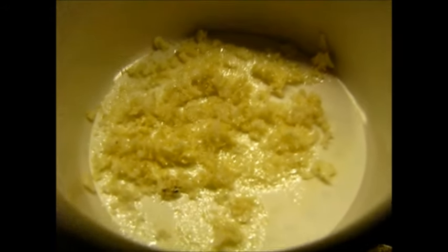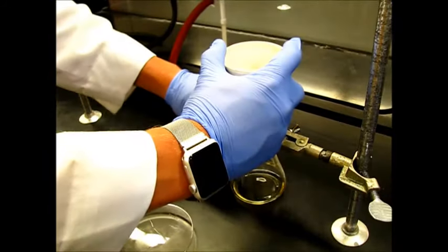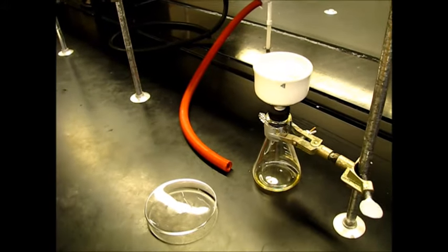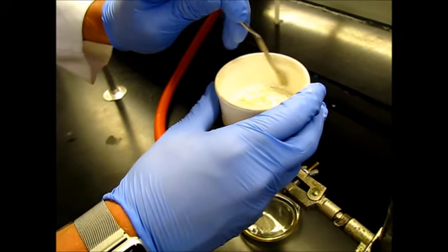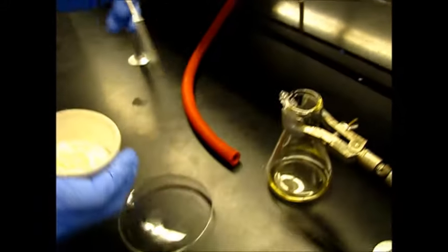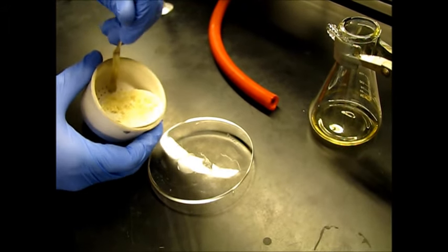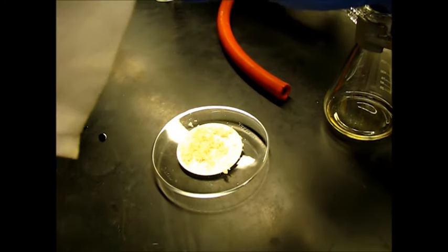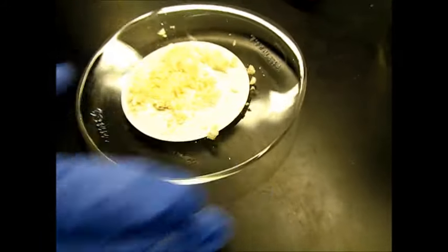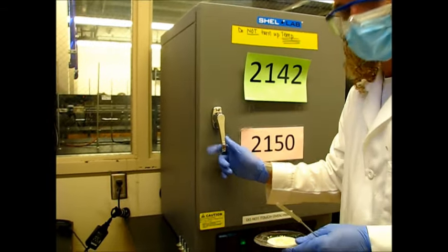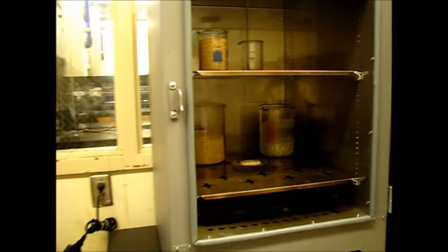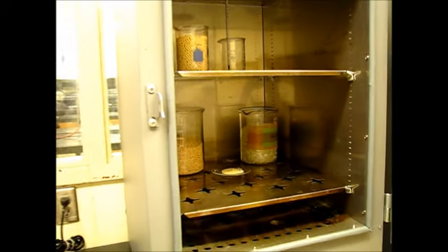So it's been vacuum drying for about five or ten minutes. It looks really good. It's got kind of that sparkle to it, which is what you would expect with this type of molecule. So what we're going to do is take the vacuum hose off first. Turn off the vacuum. We're going to get this filter paper off of the Buchner funnel and onto this watch glass. So we'll go ahead and just make sure that this is completely dry. We'll put this in the oven for about 15 minutes and then we'll get a mass for it. So I just picked the boiling stones out off camera, but we're going to go ahead and set this in here. It's about 110 degrees right now, so it should be fine. I'll put it in for about 10 minutes.